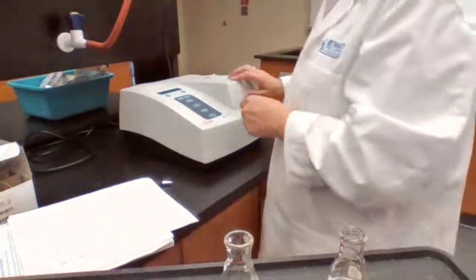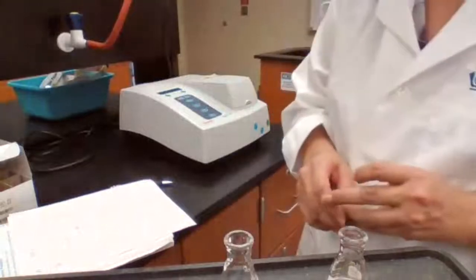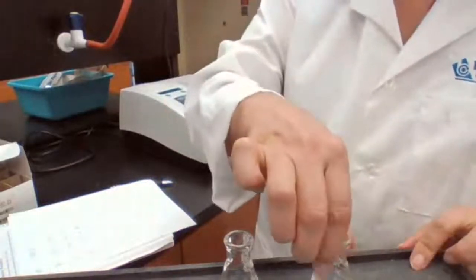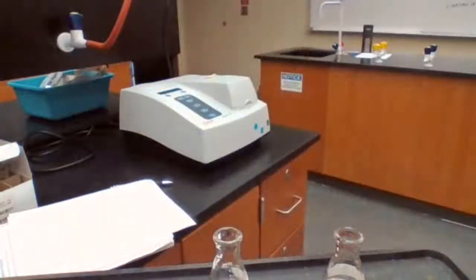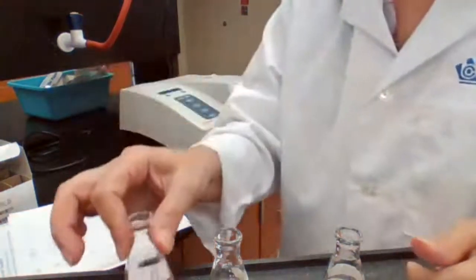So I'm taking that sample A already out and waiting for sample B. Okay, 2:02, I'm going to start with my sample D started at 2:02.